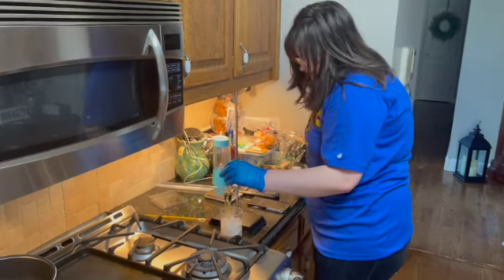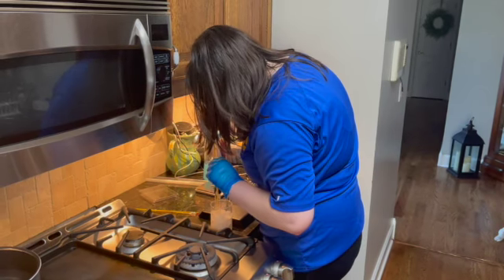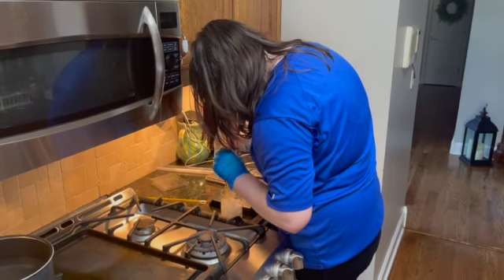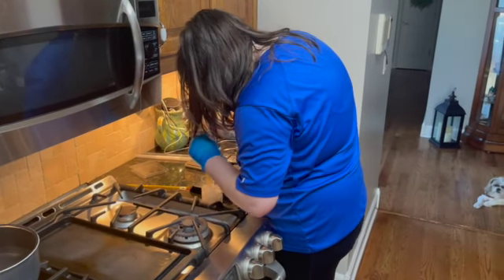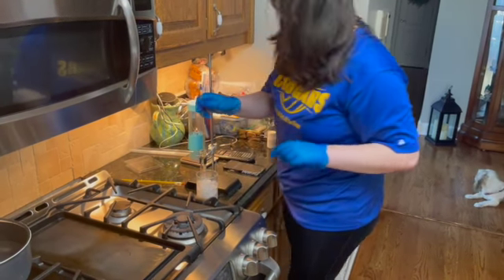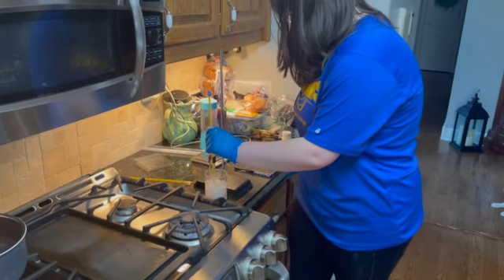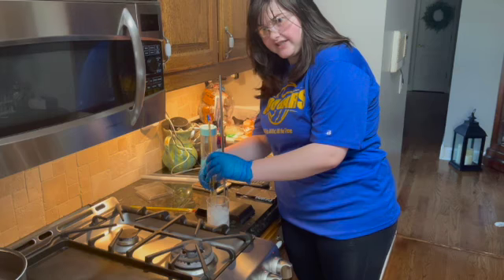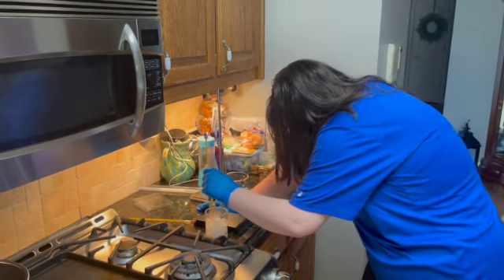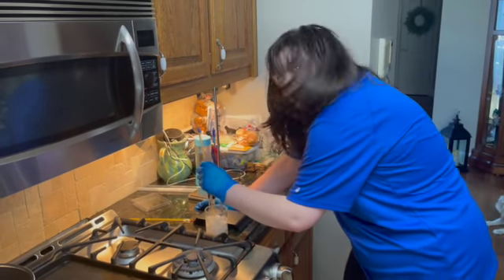It's a lot faster than I thought it would be, because the melting point took almost 21 minutes. I'm still trying to look down and see if it's completely hardened or not, because honestly it's too difficult to tell. It looks like it is, and we're at the 5-minute mark, and it is at 31 degrees Celsius.